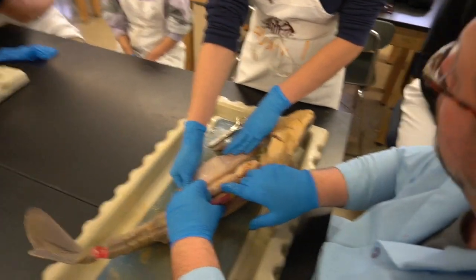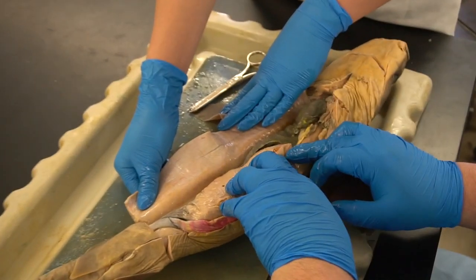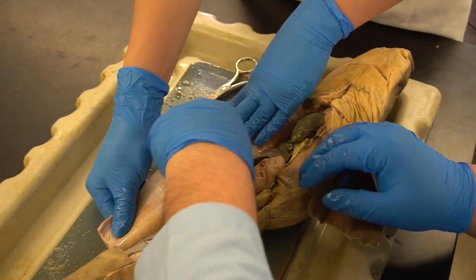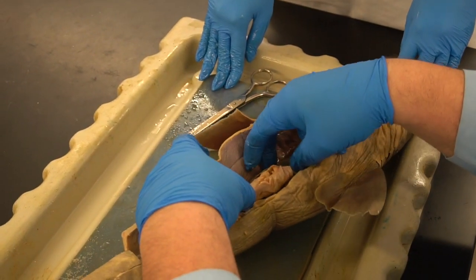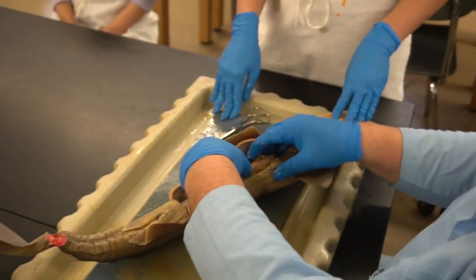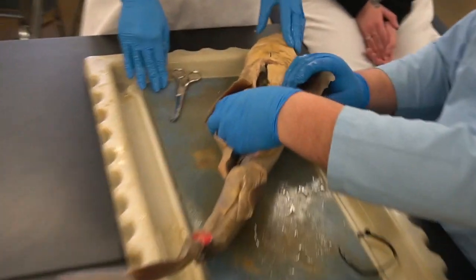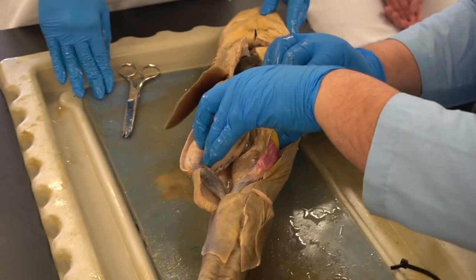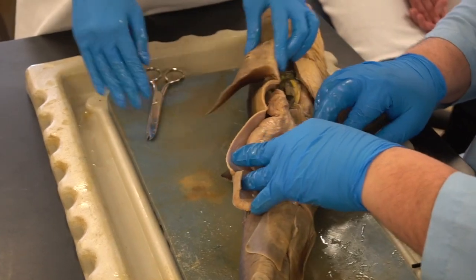Just as an example for everyone else's sake, when we cut this, we made a snip into one of the organs here. This organ happens to be a uterus. This is a female, so there was a little cut made into this one from just going a little quick through that part. The body is obviously distended because there is some developing young in here, so it did push out on the cavity, so no blame is being placed. Just be careful when you cut through so you don't damage any organs.